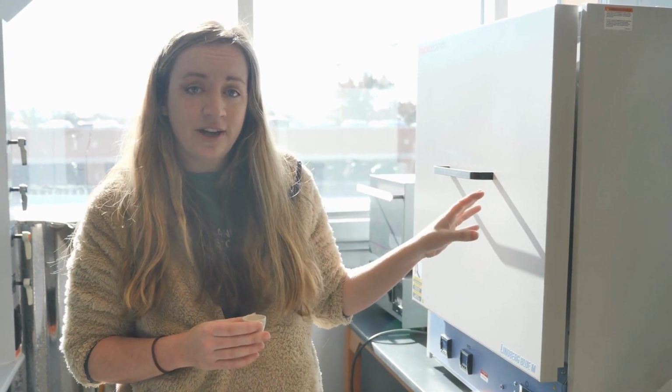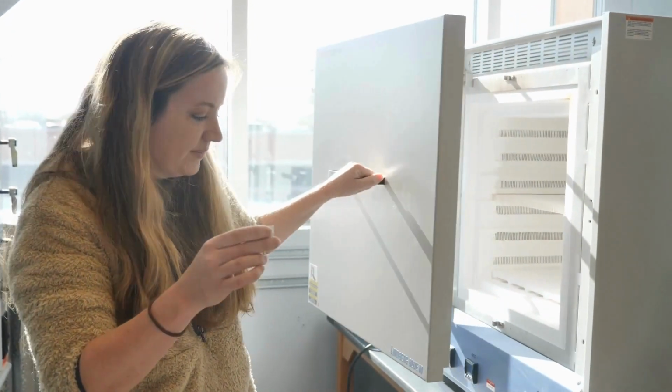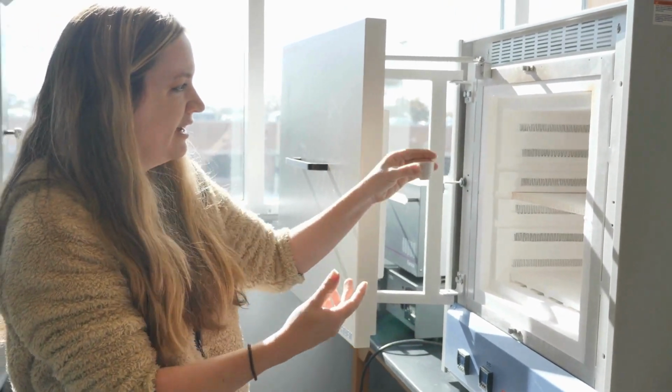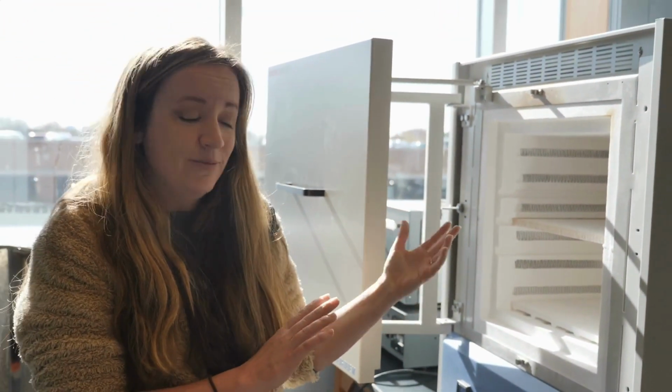Now the temperature at which the muffle furnace should be set and the duration at which you're burning your soil may differ slightly depending on the environment you're in or what you're interested in measuring. So make sure that you check the appropriate methods before determining the temperature and duration. But essentially, you would load your crucibles into the oven. For some methods, you can load them while the oven's cold. For others, the oven needs to be hot when you put them in, so again, make sure that you're checking the right methodology. I also recommend capping the crucibles so that no organic matter pops and disrupts other samples while they're burning.